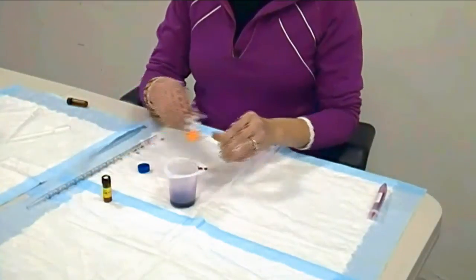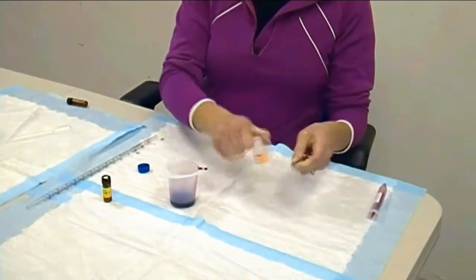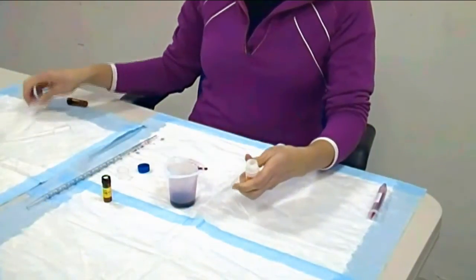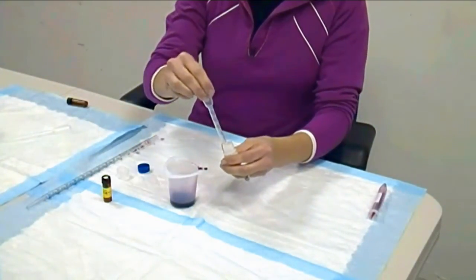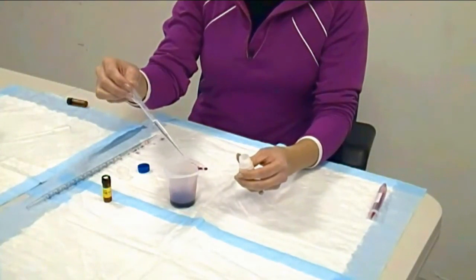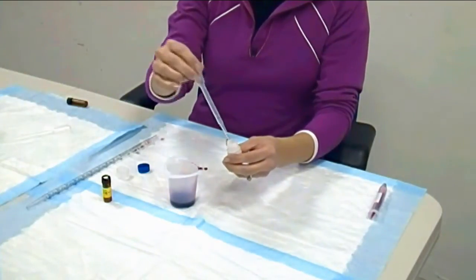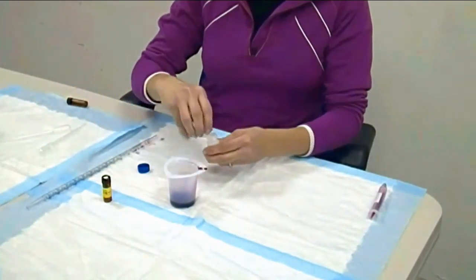And now I'm going to add my boost juice. Gently shake the boost juice. Using your transfer pipette, carefully add 5 drops. Now mix your 10 ml wine sample.